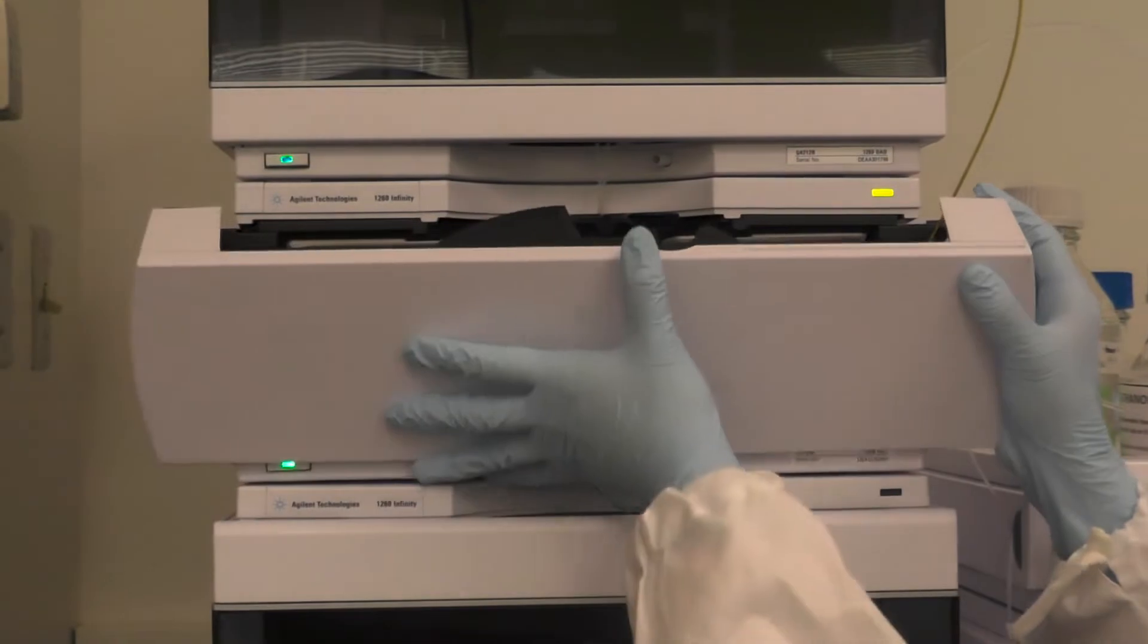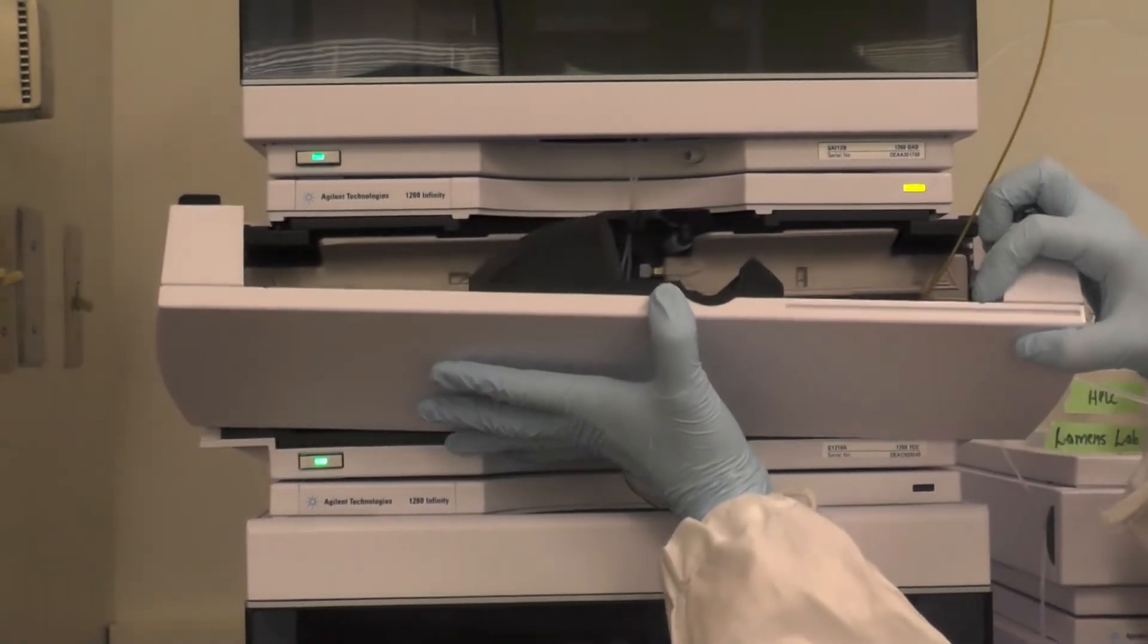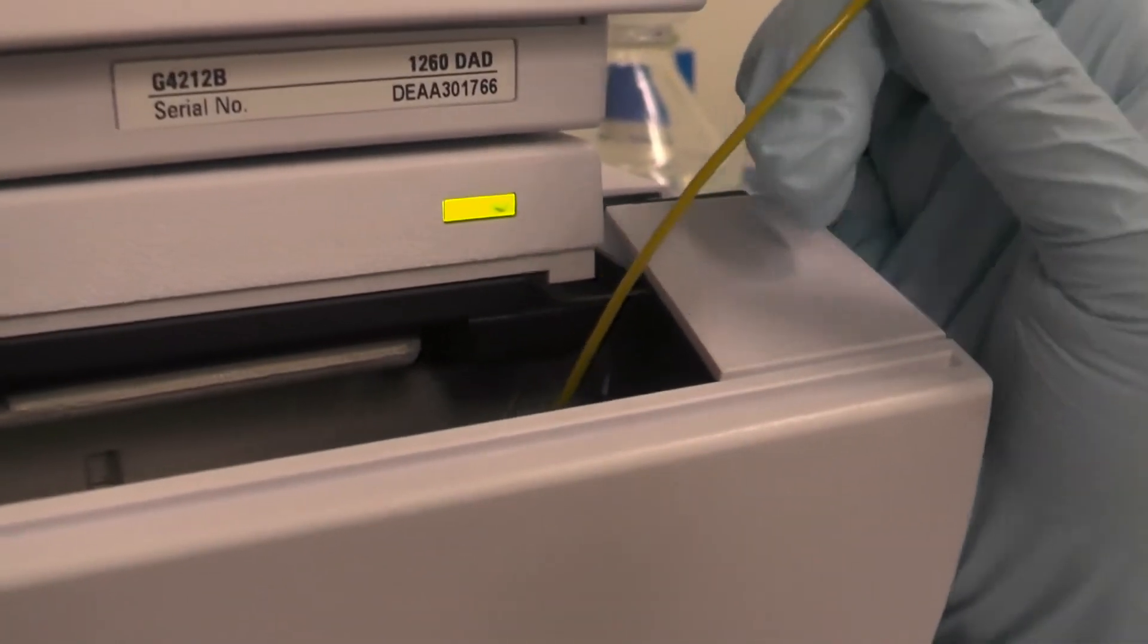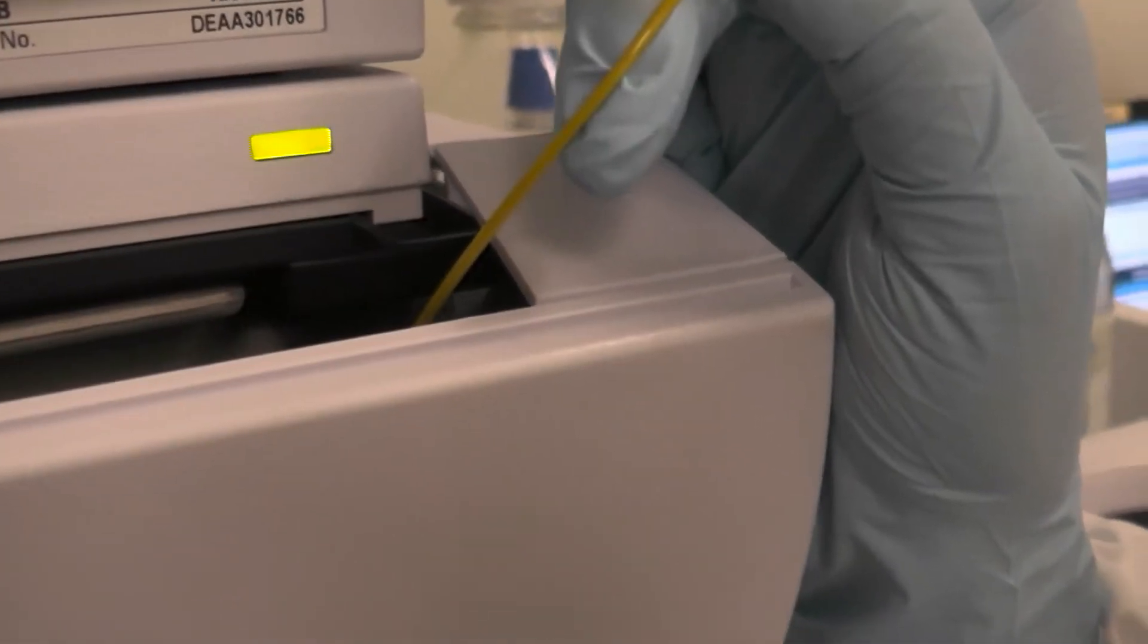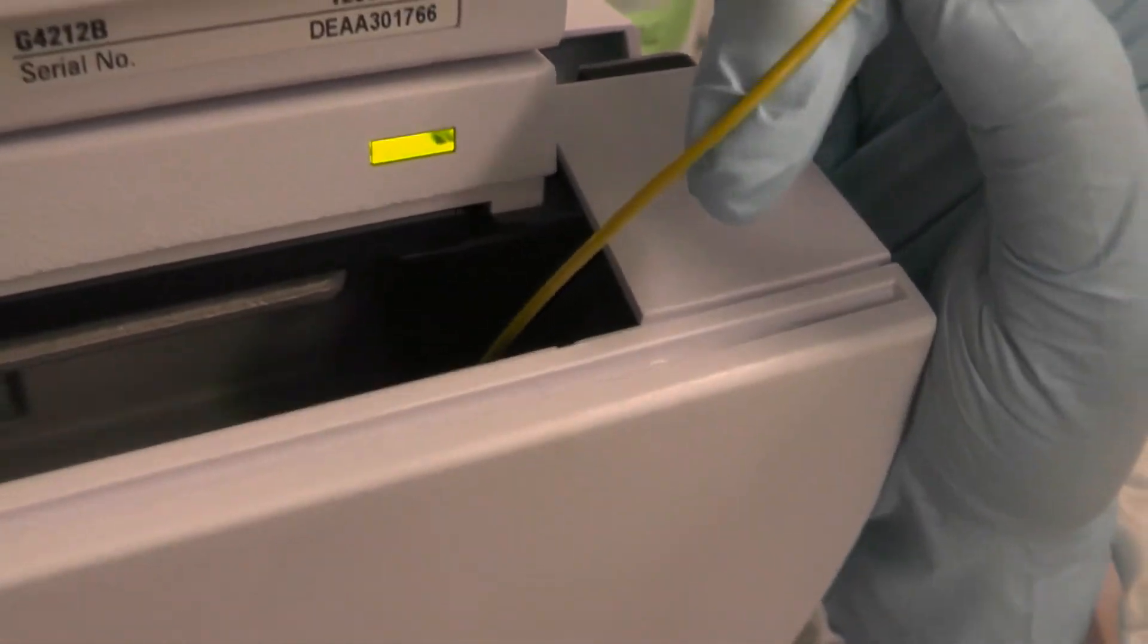When closing the cover of the column compartment, make sure all capillaries are fitted into the slots and are not pinched by the cover. Otherwise, the liquid may not flow properly.